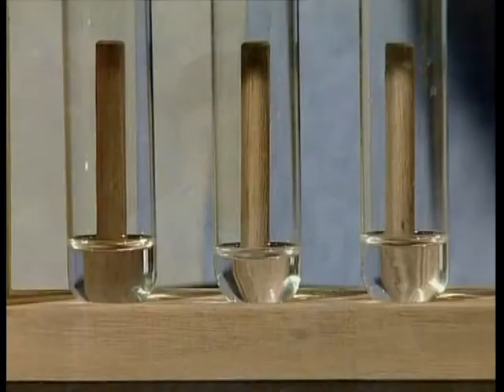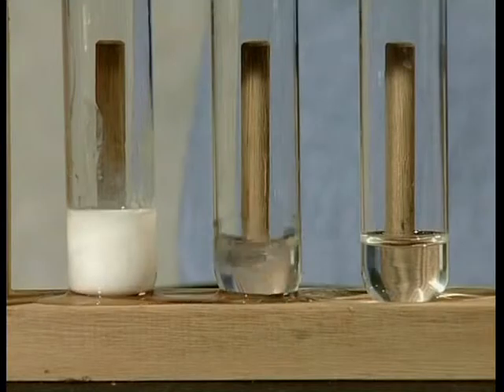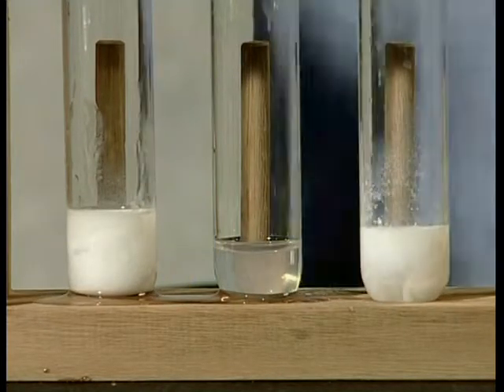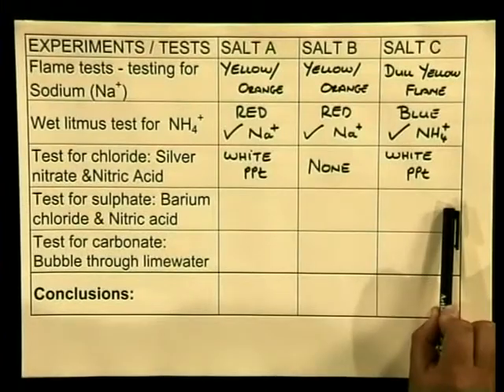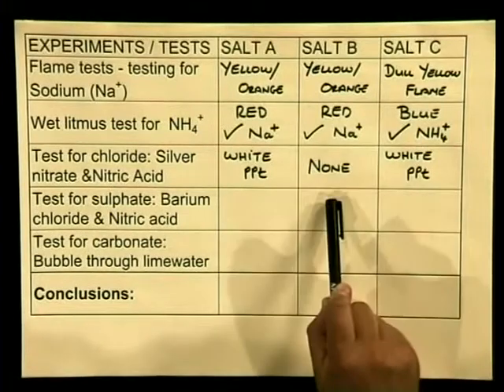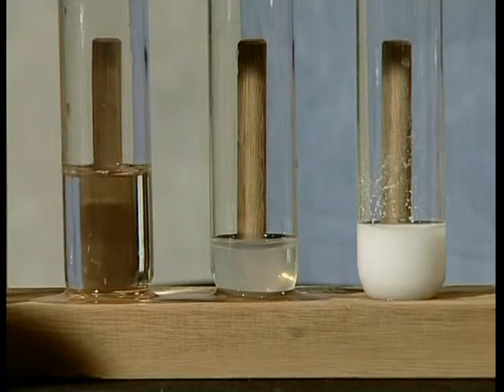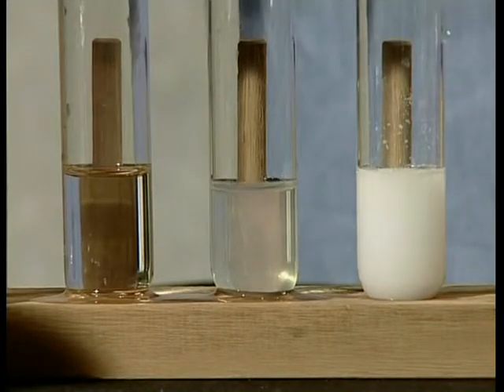Now let's have a look at the test. Add a few drops of silver nitrate solution to each of the solutions in test tubes A, B and C. Watch carefully and record your observations. A white precipitate formed in test tubes A and C. No precipitate formed in test tube B. Now we must carry out the second part of the silver nitrate test — nitric acid needs to be added to the precipitates that are formed. Watch carefully as we add the acid to the precipitate from A and C. Remember, only one of the salts is a chloride; the other precipitate must be a carbonate.